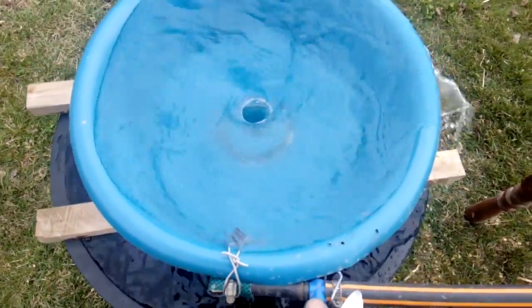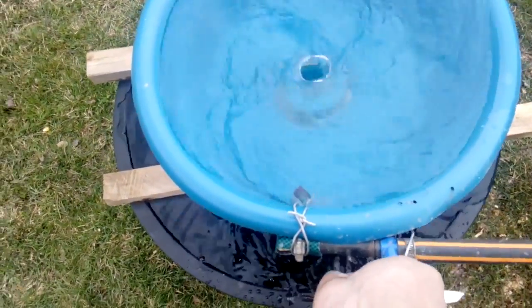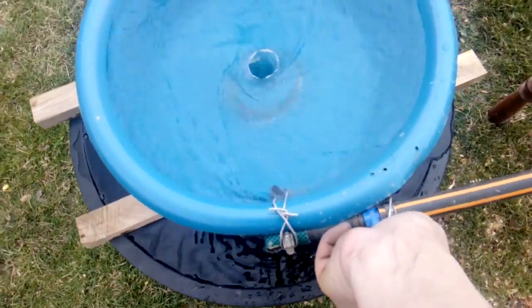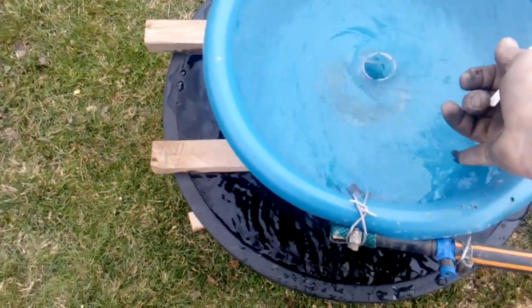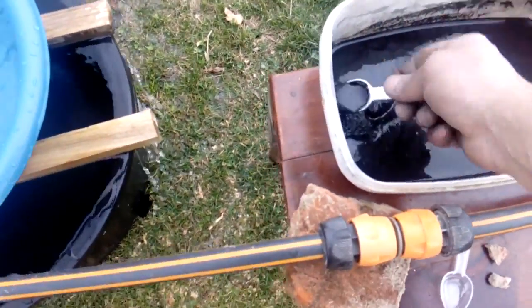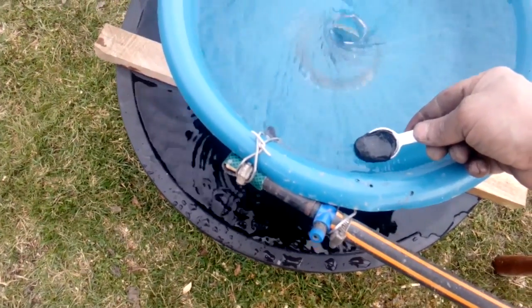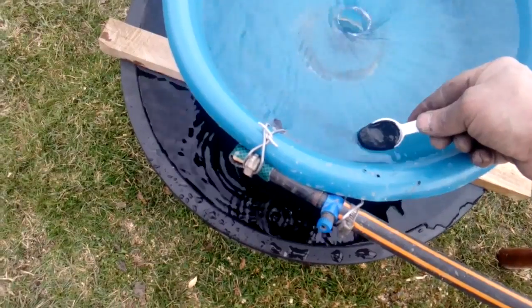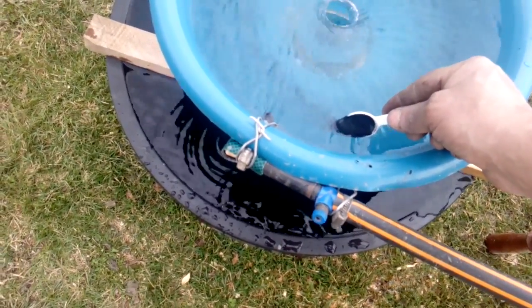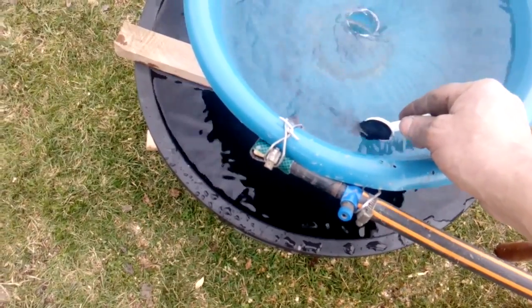For the first pass, just a little down-pressure. When you start using the blue bowl, you need to use lower pressure. You don't want to lose your gold immediately. You have the black sand and just a little flow behind the tube. This needs to be done slowly. If you go too fast at anything in the refining and recovery process, you will always lose your gold, and you don't want that. Believe me, I learned from my mistakes.